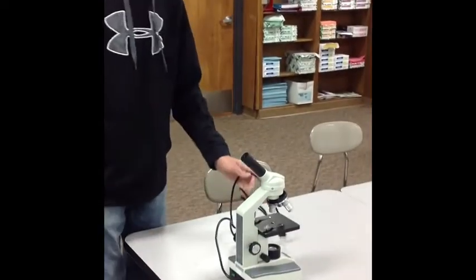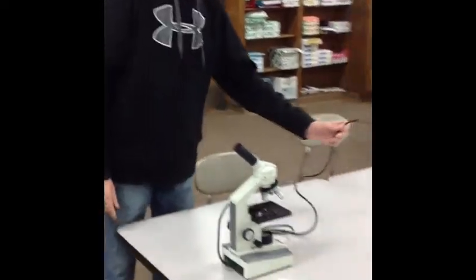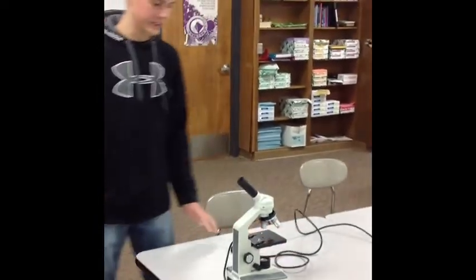When you plug it in, always make sure it's off first. And always plug it in from the front just like this so the cord doesn't get cut.